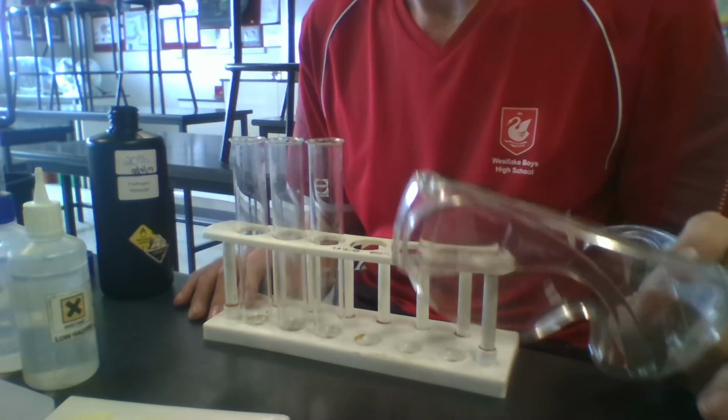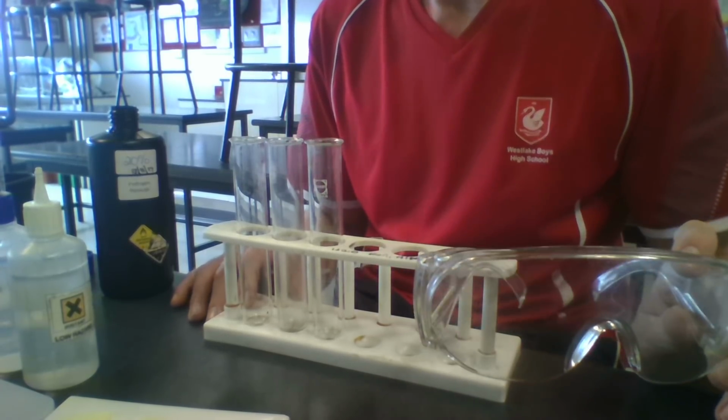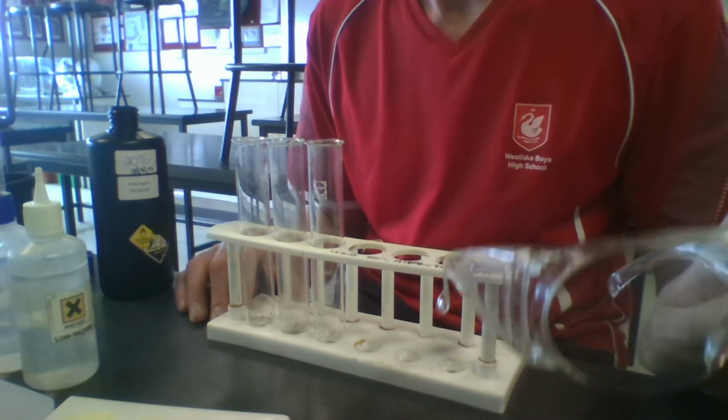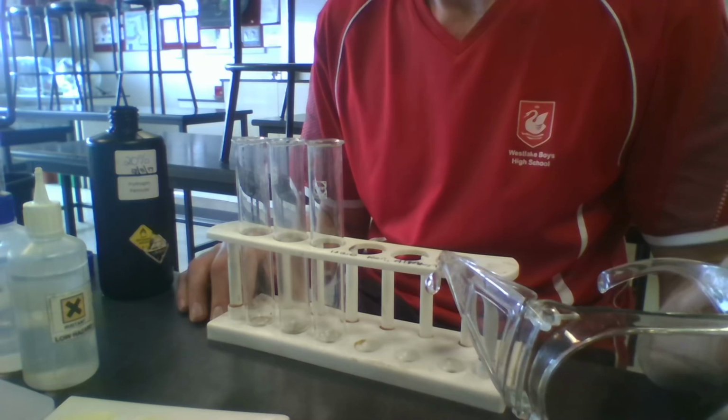And welcome to the instruction video for your Biology 1.1 internal assessment. Today you're going to be investigating the effects of pH change on an enzyme reaction, and I'm going to show you how to do it.